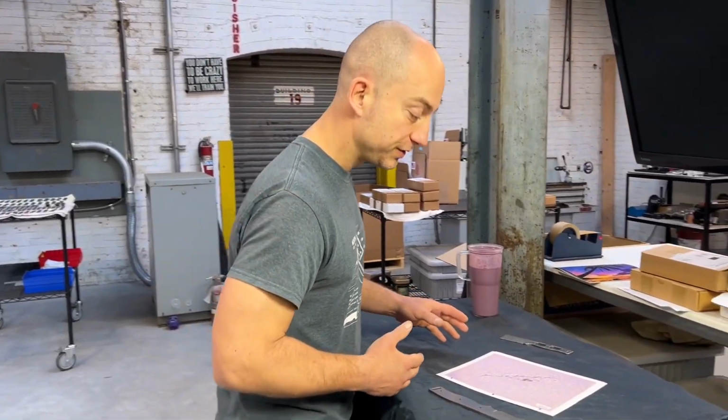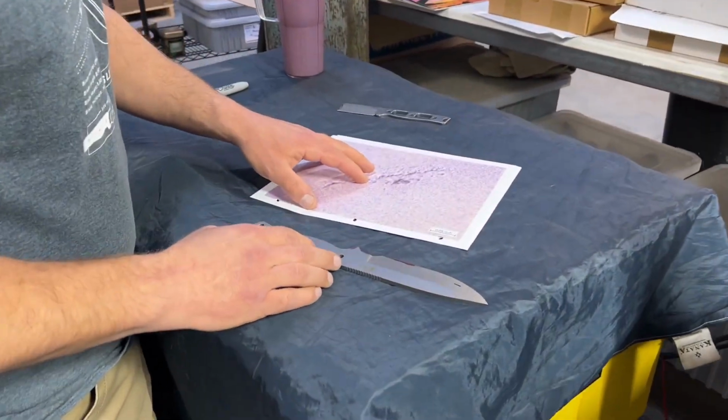Good morning, everybody. Before I really get started for the day here, I just wanted to explain all these lab photos that we've gotten so far. We did get that follow-up where we had cut into the part now at the lab and we're looking at it from the side. So I just wanted to explain everything we've learned so far. Coming right in here, we're going to look at a couple parts and some of these photos.